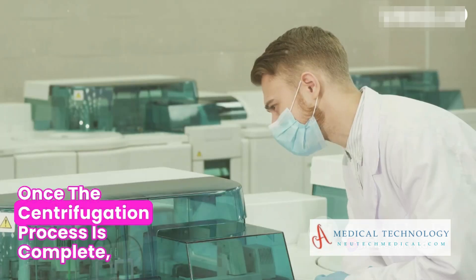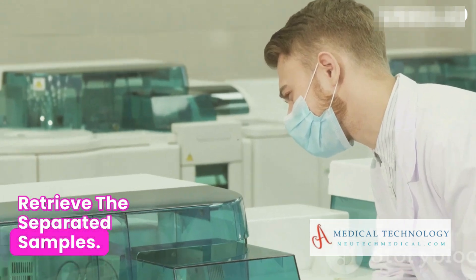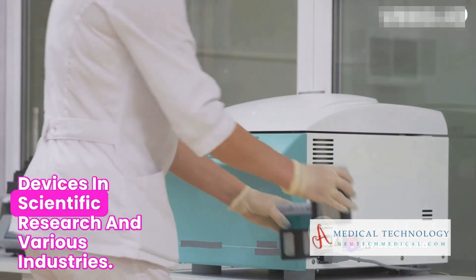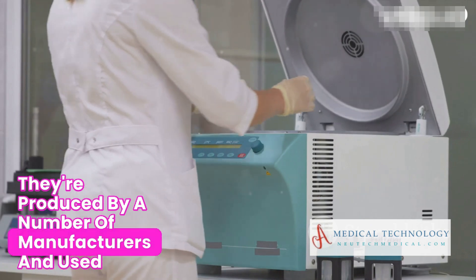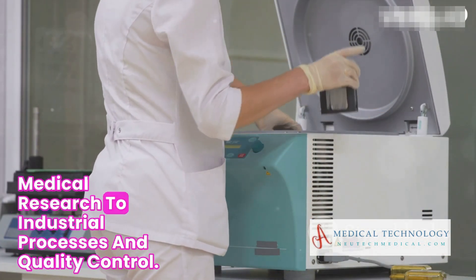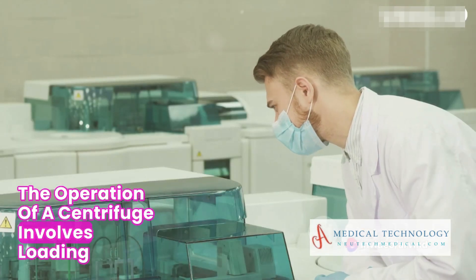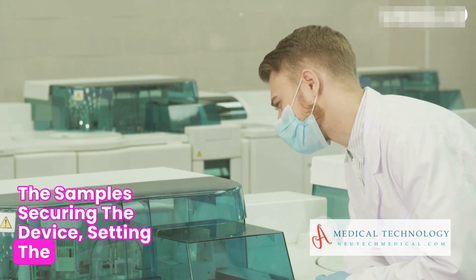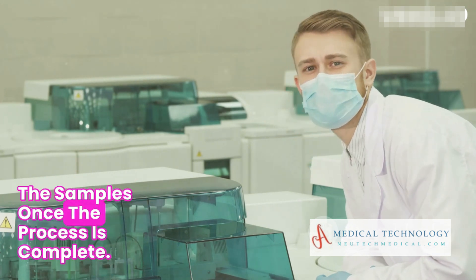Once the centrifugation process is complete, you stop the machine and carefully retrieve the separated samples. To summarize, centrifuges are incredibly important devices in scientific research and various industries. They are used for a wide range of purposes, from biological and medical research to industrial processes and quality control. The operation involves loading the samples, securing the device, setting the parameters, starting the centrifuge, and finally retrieving the samples once the process is complete.